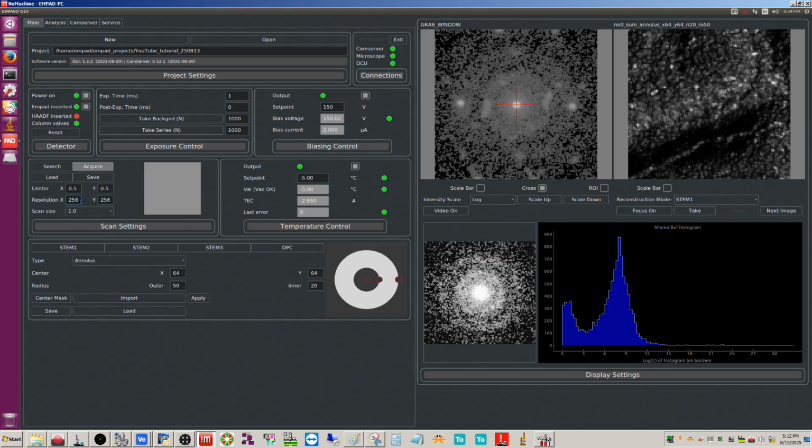You can go as high as 512 by 512. But again, if you change this number, you have to make sure to hit enter each time, or else it turns red. Now you can see this actually turned it into a rectangle, okay?